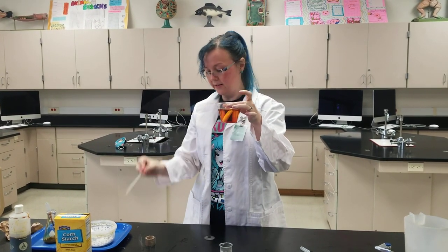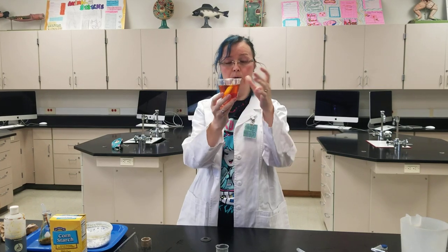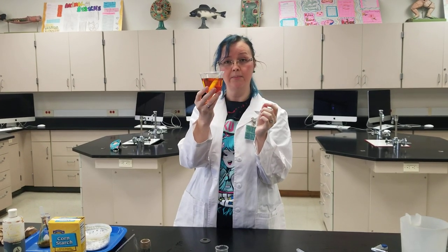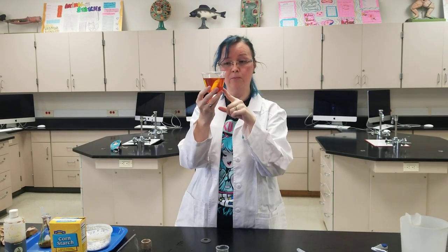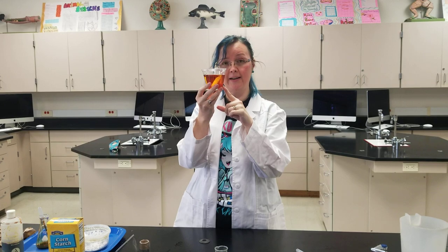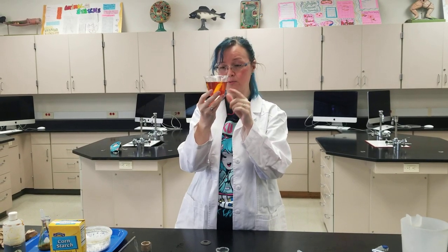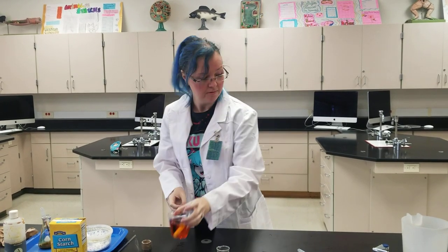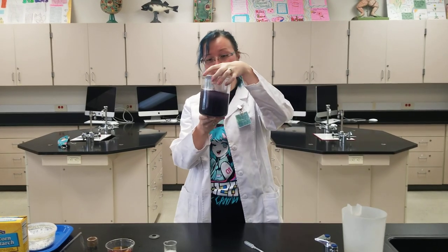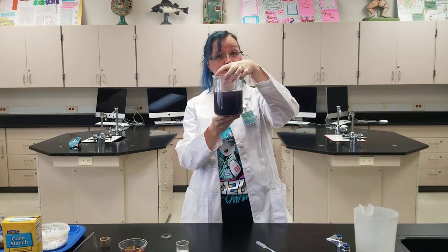So what we want to find out is: is this dialysis tubing semi-permeable to the starch or to the iodine? To find that out, we've separated them — the starch is on the inside, and now I'm going to take some of our iodine and put it on the outside, and mix it up. Now we're going to leave this overnight and try to find out which one is going to be the permeable one — will it be the starch or will it be the iodine? How will we know which one is permeable? Well, we'll be looking for this reaction to happen. See you in 24 hours.